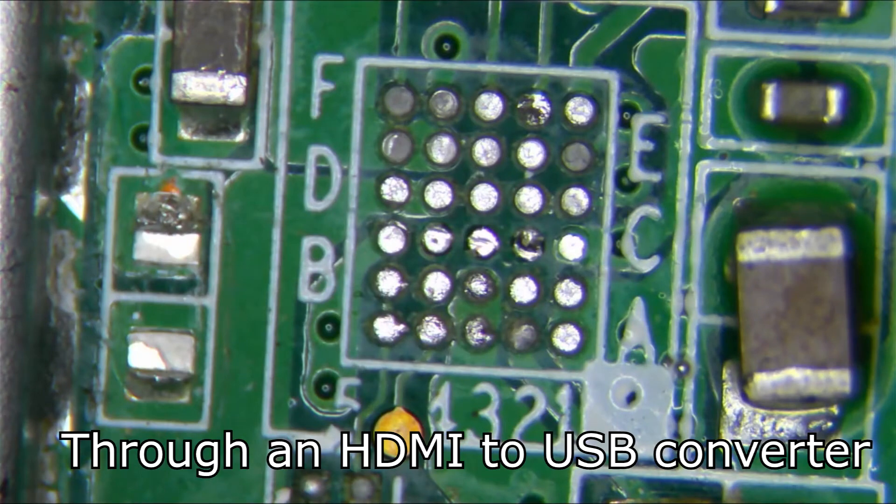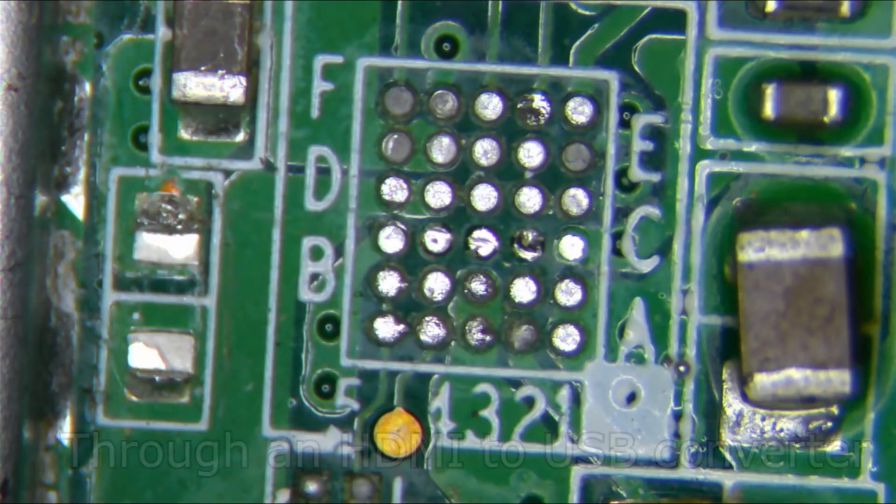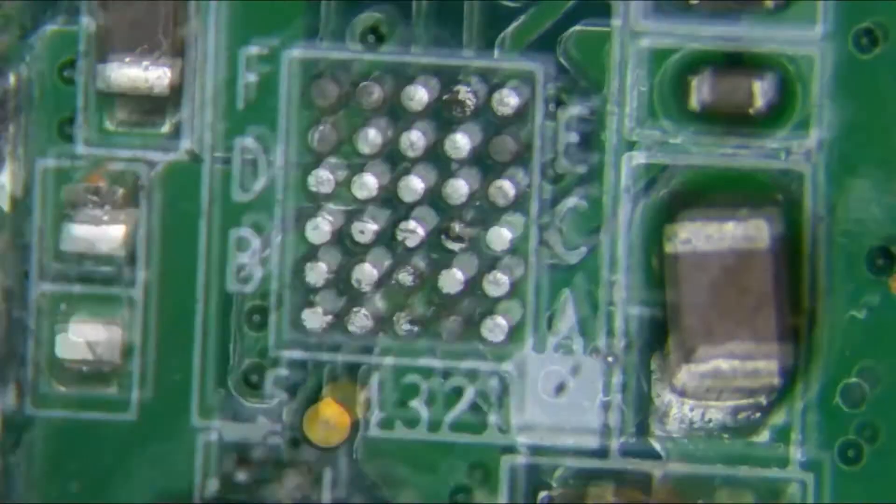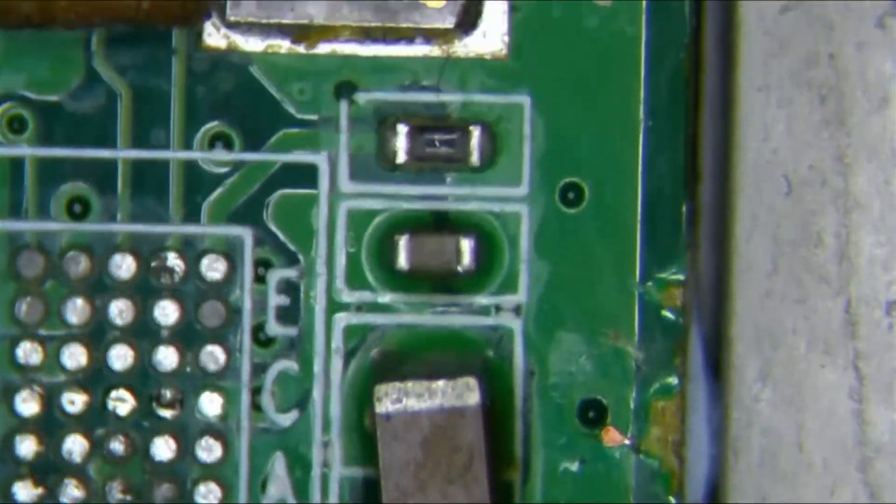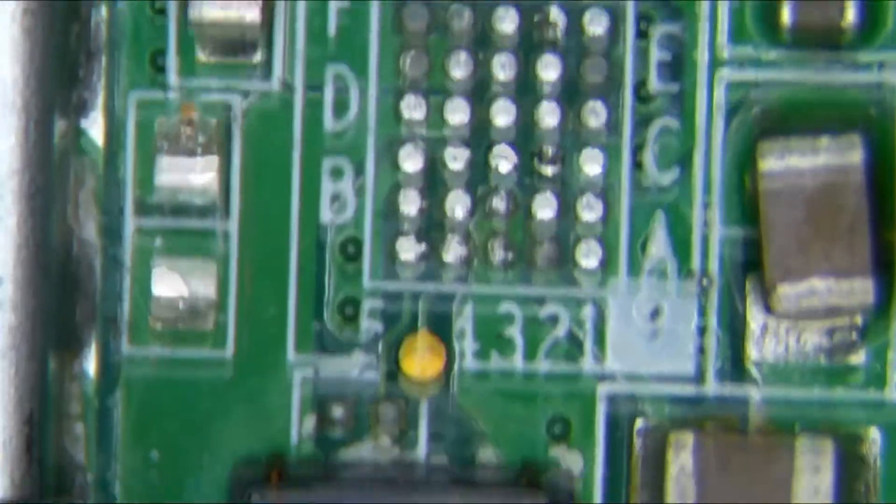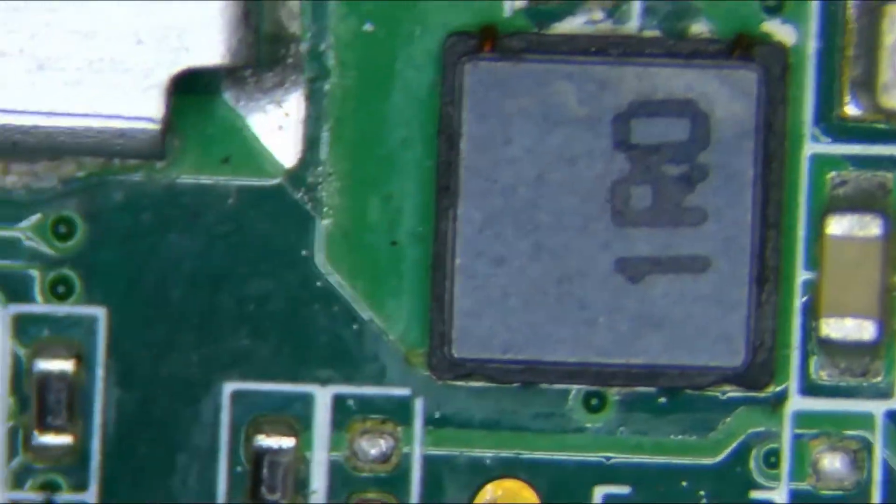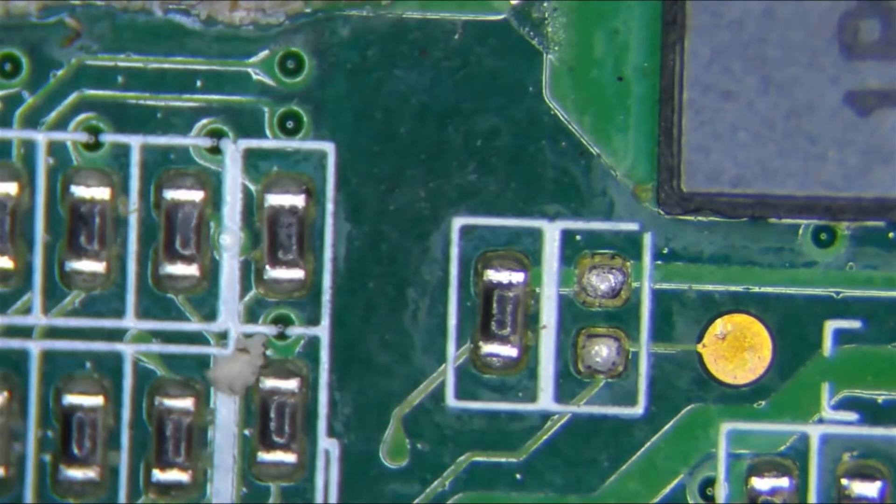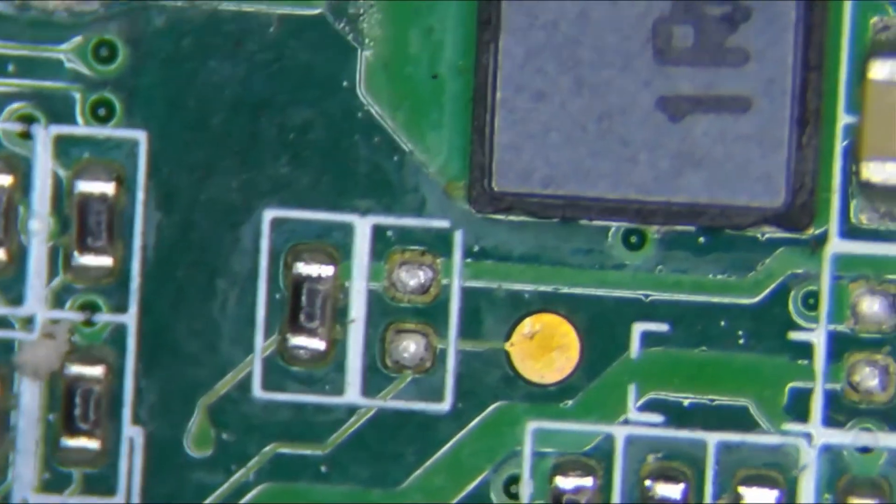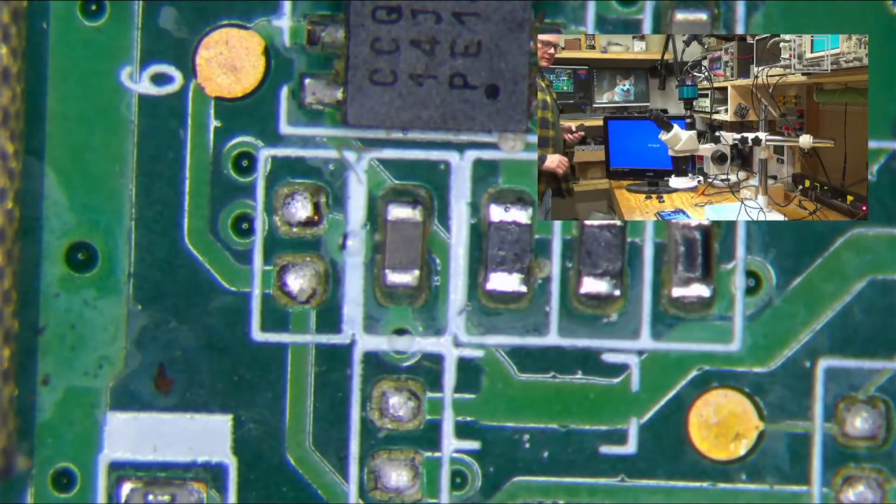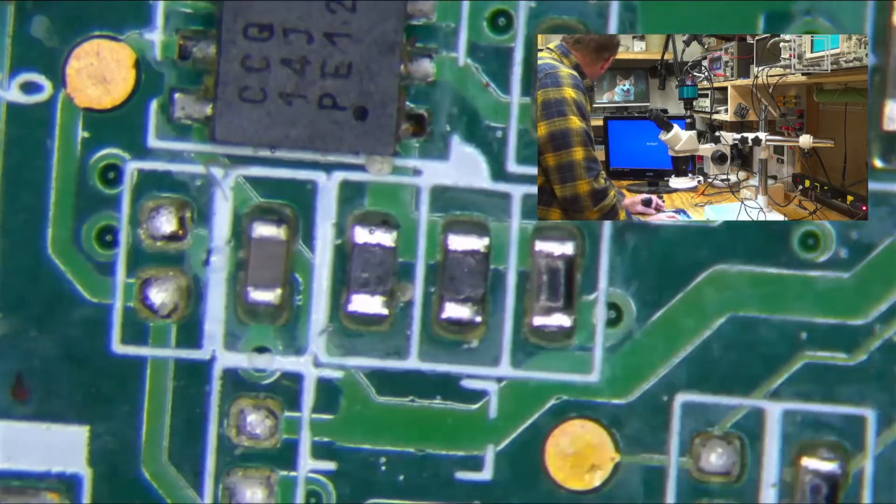Okay, so now it's coming right into my video feed, right? So you can see as I move my part around, and I'm going to look right through the glass. Yeah, it really works nice. So yeah, that's pretty cool.